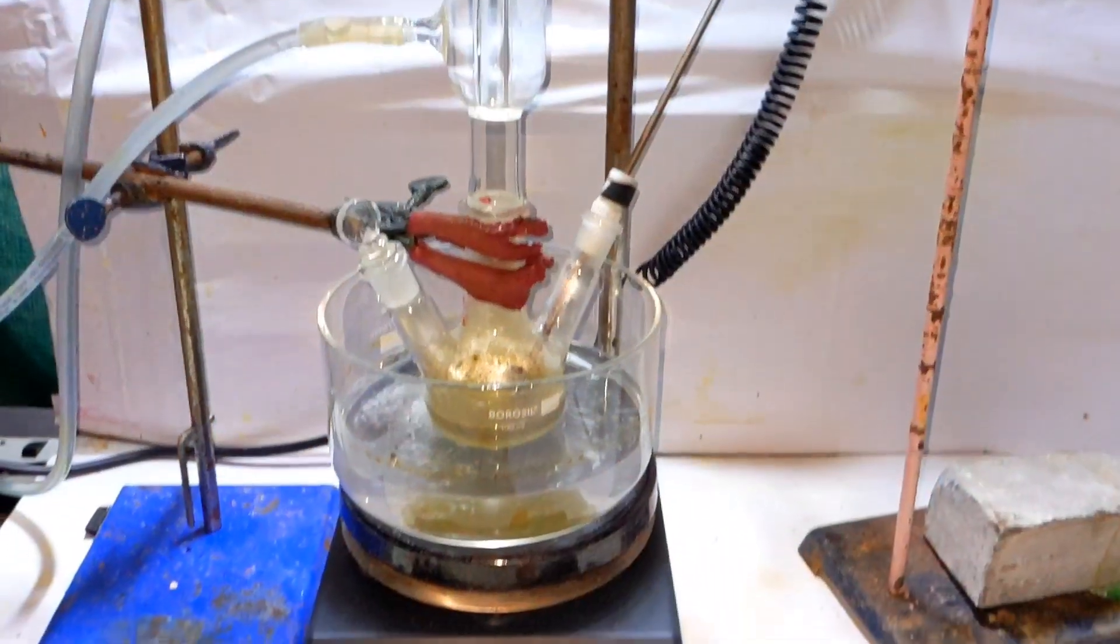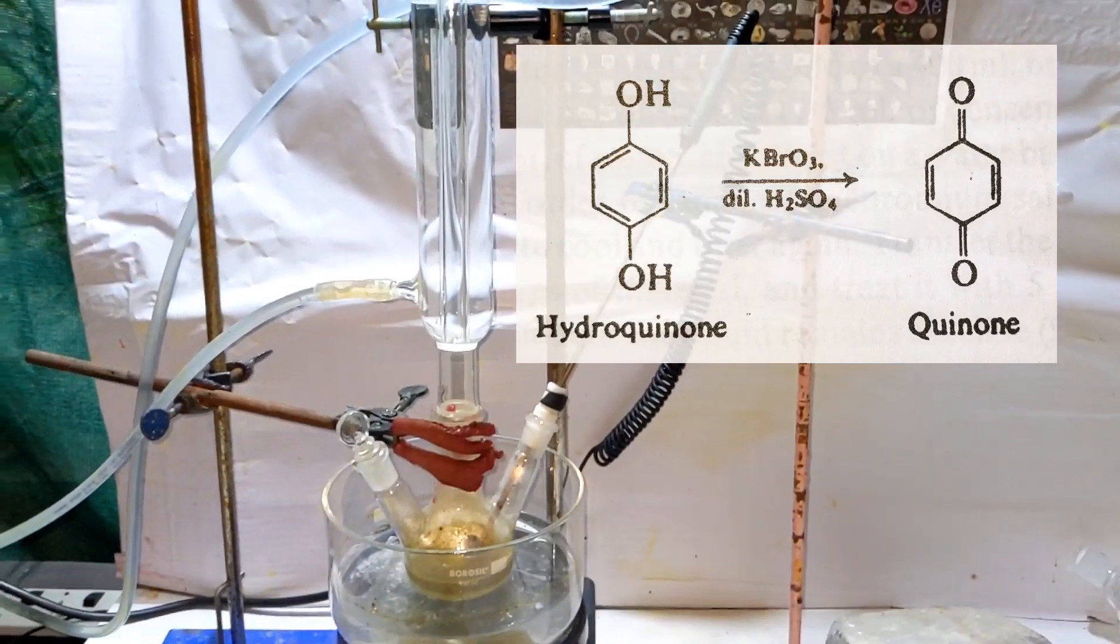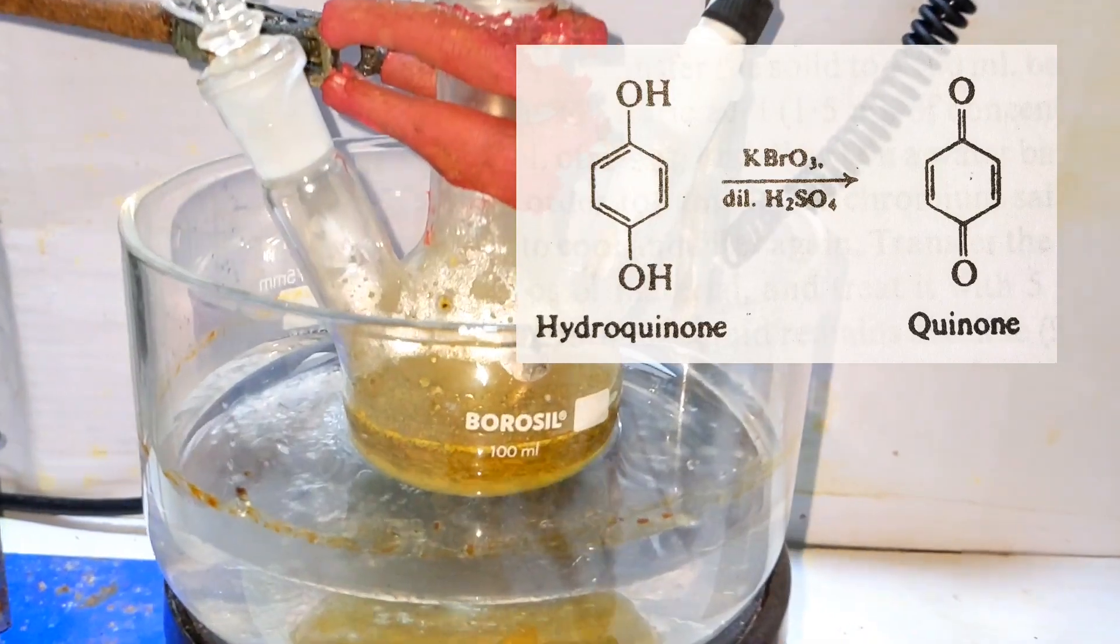After a few minutes you can actually notice a rise in temperature. What is happening here is hydroquinone is getting oxidized by the potassium bromate solution in very faint acidic condition to produce quinone.